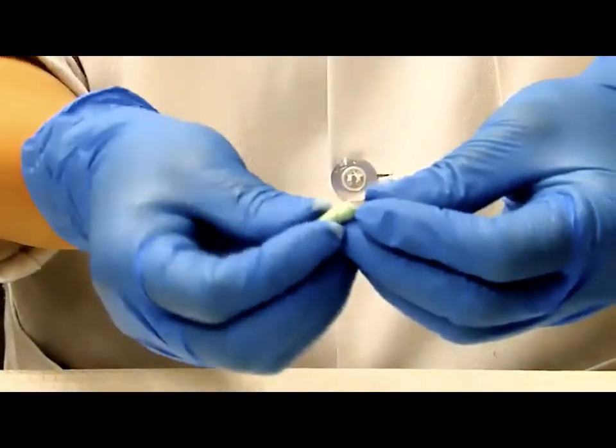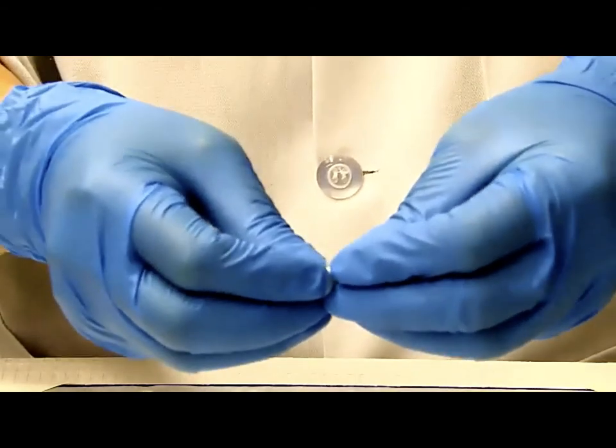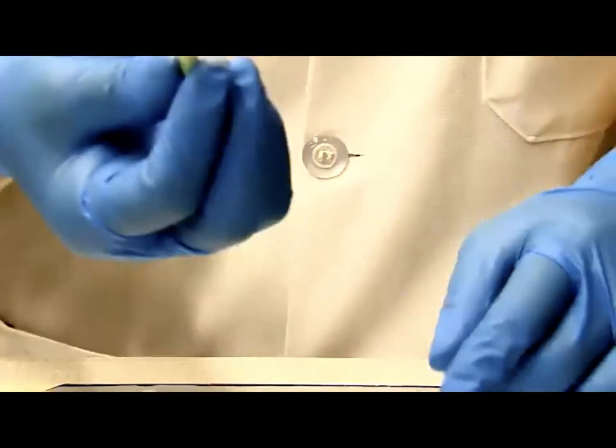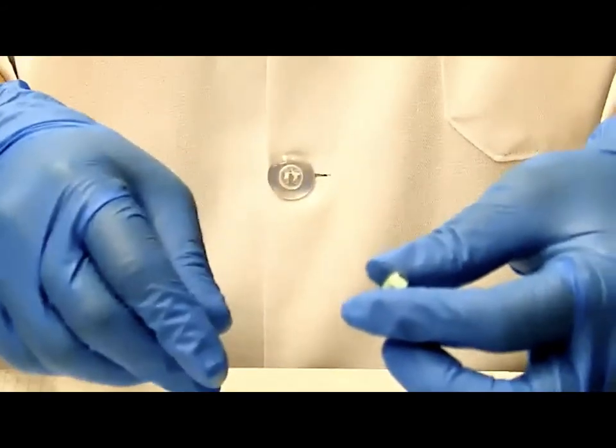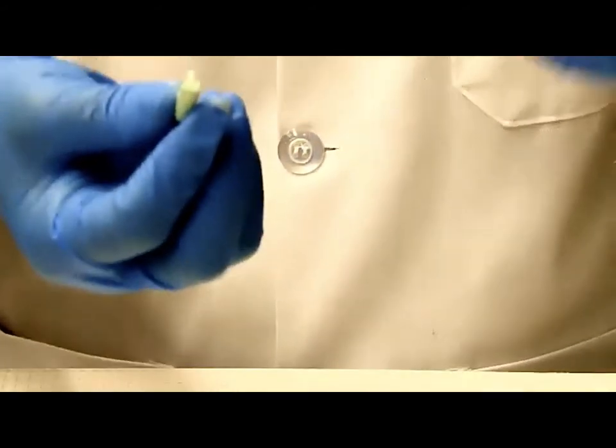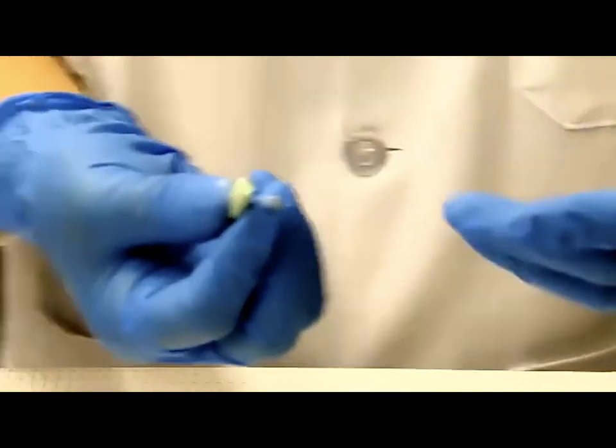At some point you think, oh, maybe I'm quite there. I'm very close to the weight that I need, so you can place on the cap. But be careful, don't lock it because your weight might be wrong. So you just put the cap on loosely, not locked. And now let's go ahead and check our weight.